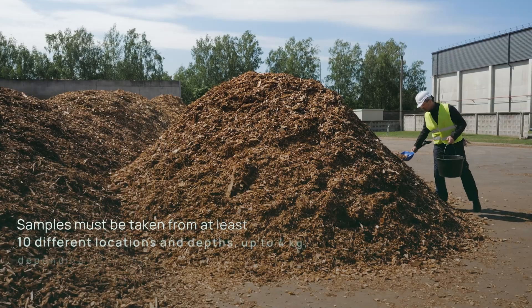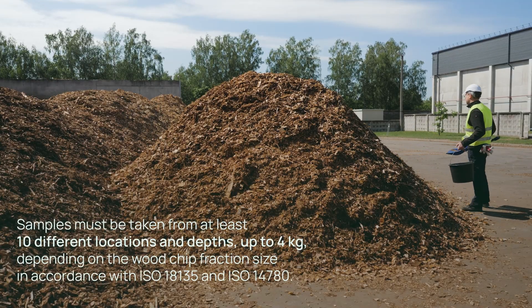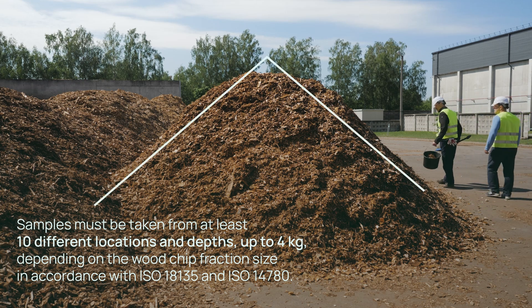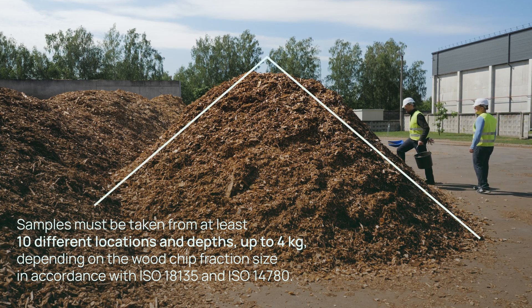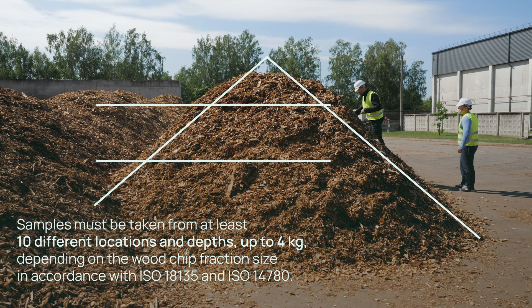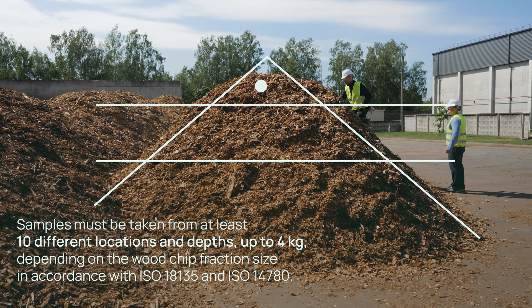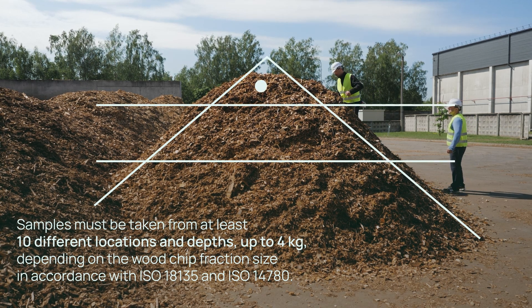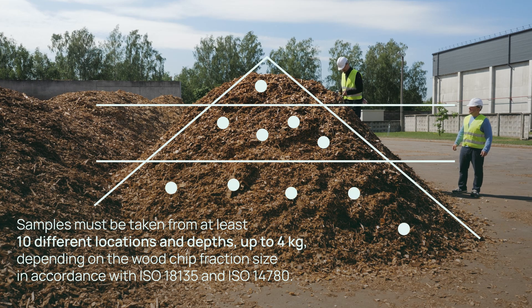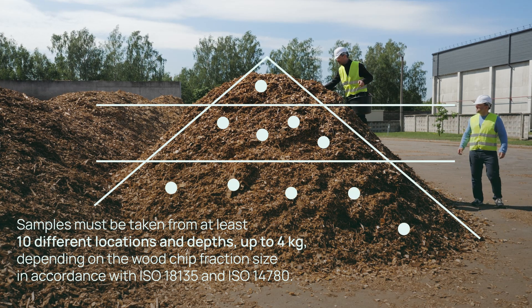Samples from an unloaded pile of wood chips must be taken from at least 10 different locations and depths, in accordance with the pyramid principle 1 plus 4 plus 5. For instance, one sample is taken from the upper layer of the pile, four samples from the middle layer, and five samples from the bottom layer.